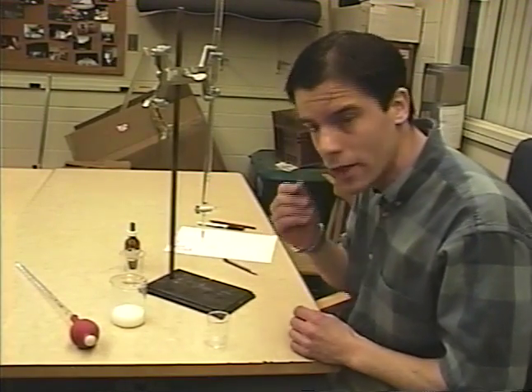Well, hello there. The purpose of this tape is to show you how to do a titration. It's not necessarily to tell you a lot about the lab that you're going to do in this particular case, but it does show you how to do a titration no matter what lab you're doing.